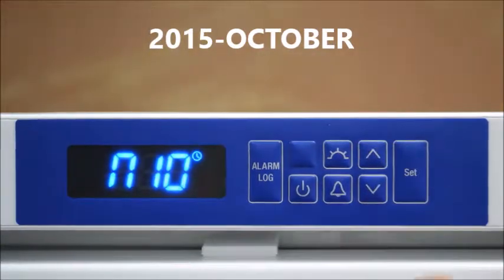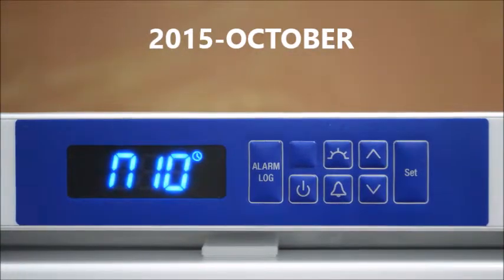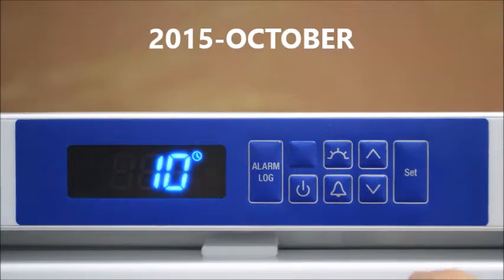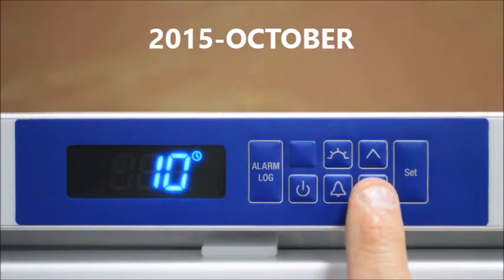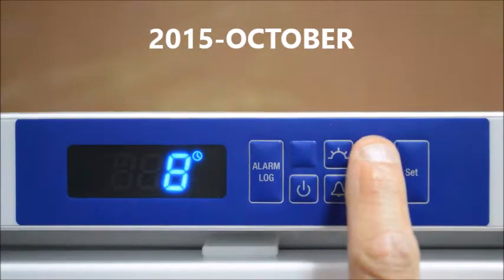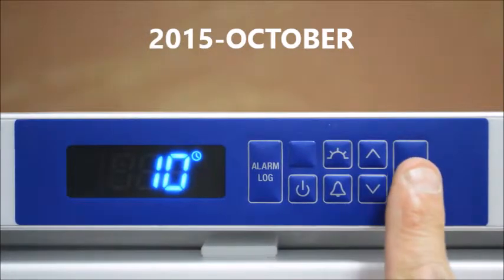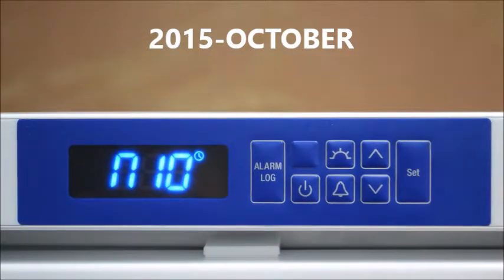By pressing the up arrow we can now change the month. Press the SET button and scroll up and down until the correct month appears, then press the SET button and the month is locked in.